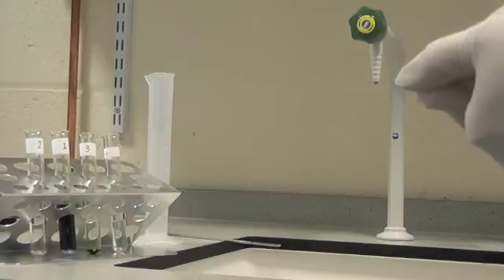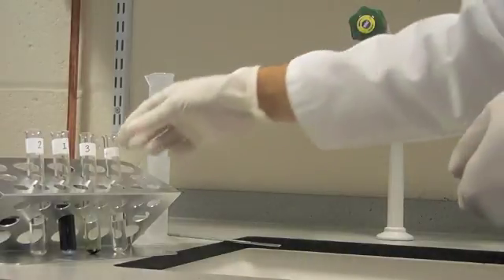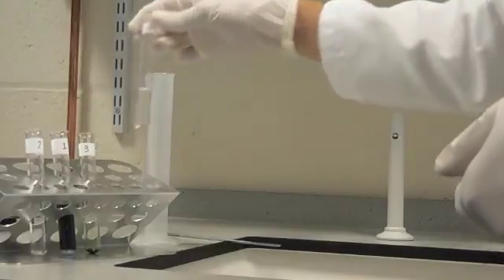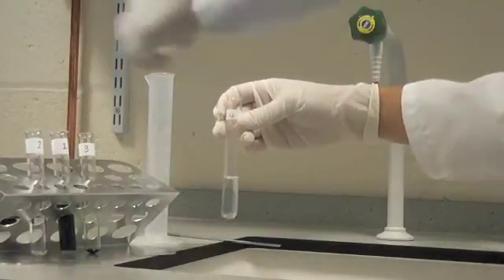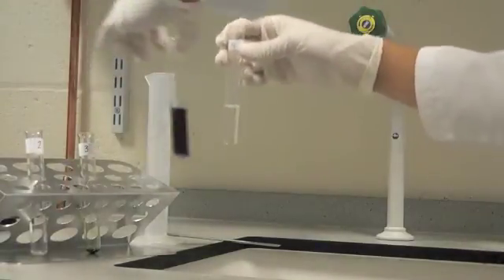Finally, over a sink, carefully pour in the ethanoic acid, test tube four, into test tube one, and observe the reaction.